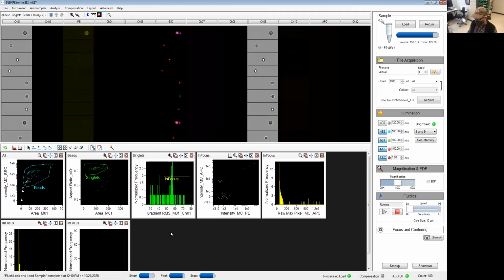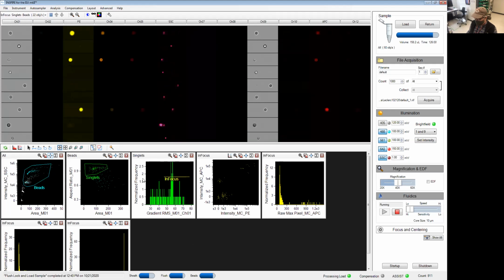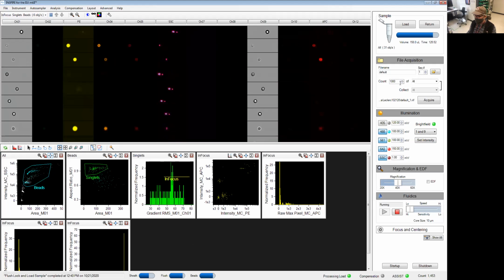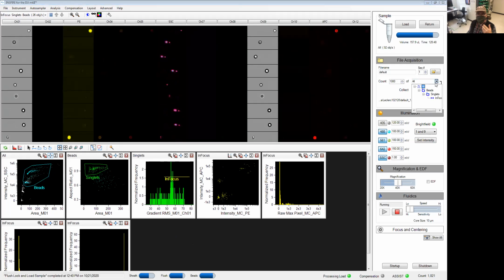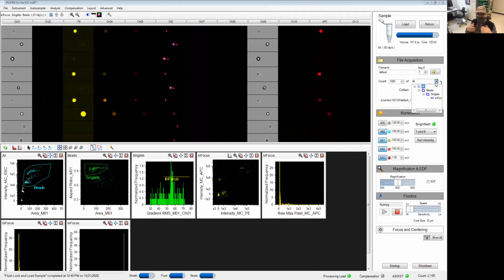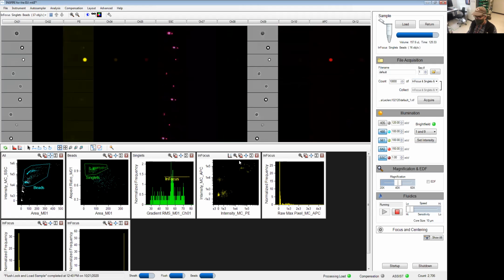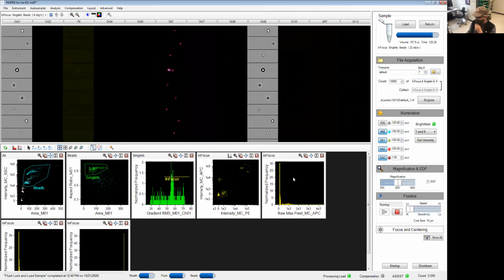At this point, we're just going to go ahead and record the events. In general, you could select a specific population of events to do your counting. So that's what we're going to have here. Count tells the software how many cells need to be counted before we stop the acquisition. You're going to gate from either all of the events or a specific gate. If you have a population of interest that you need to study, you might want enough of these events to do proper statistics. So in that case, you might say, I want at least, say, 10,000 events of cells that are in focus, or that have a specific feature. So that's what you're going to decide here.